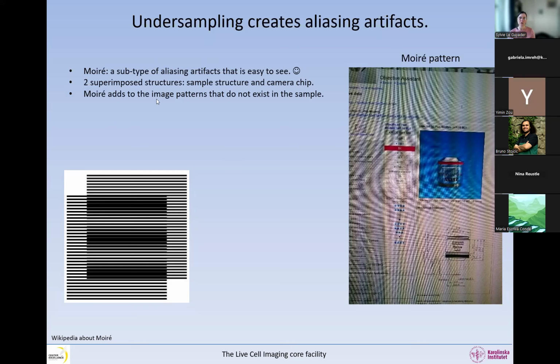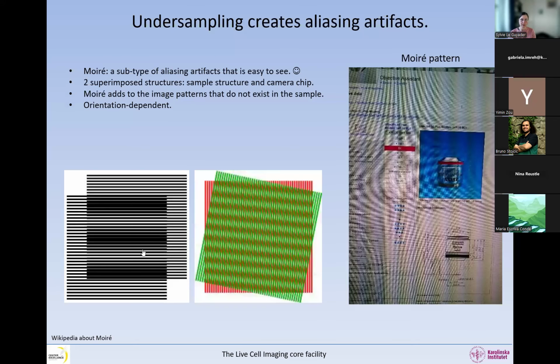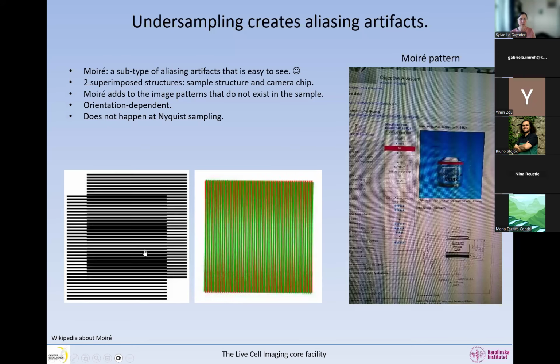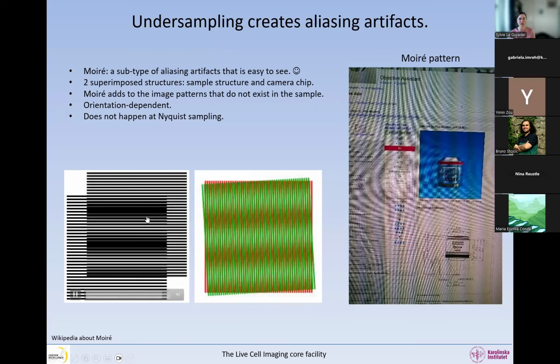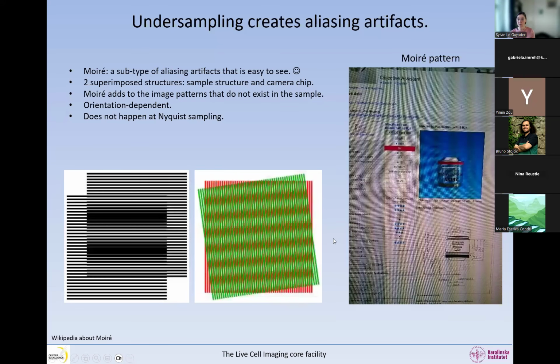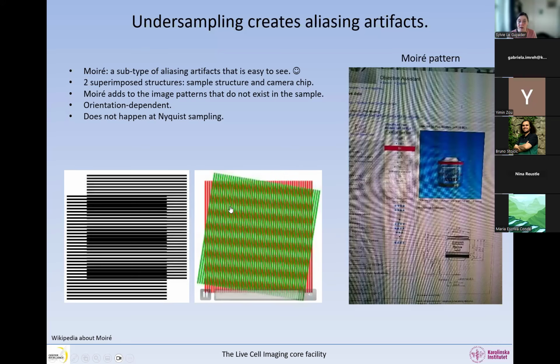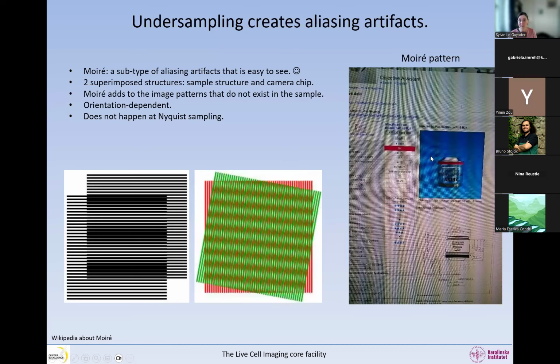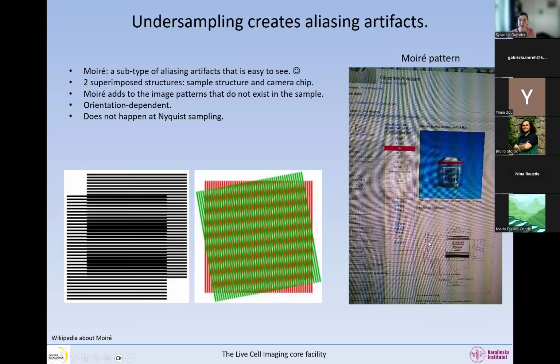What you can see is that moire adds patterns to the image, like these big black bars, patterns that do not exist in the sample. You can say this would be the sample and this would be the camera, and we have these big bars that do not exist, but they show up in the image. On top of that, moire is orientation dependent. Oh, I forgot to play the little movie. You can see that as we move the camera, these patterns are moving. But as we rotate the camera, the size and the thickness of these are also changing. Depending on the angle, they can go curvy like this. This is why here we have all curves.